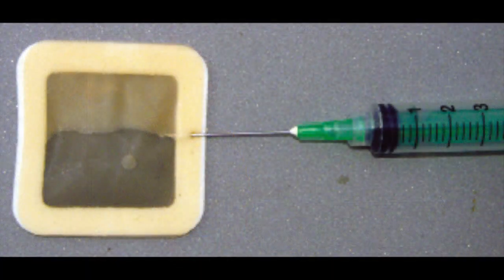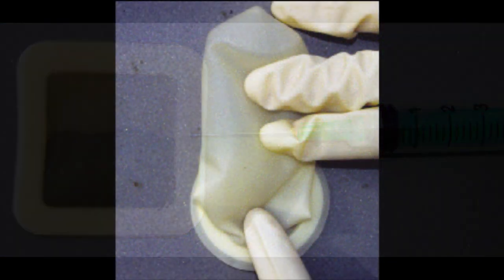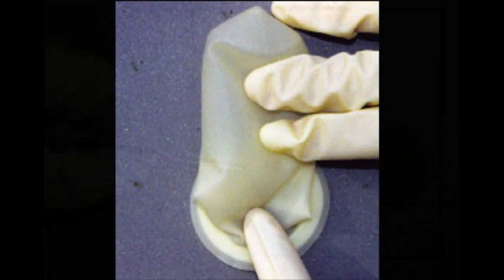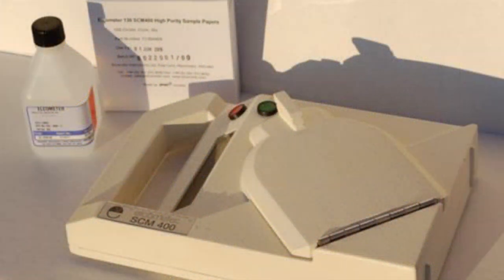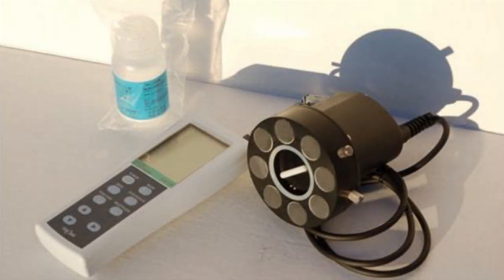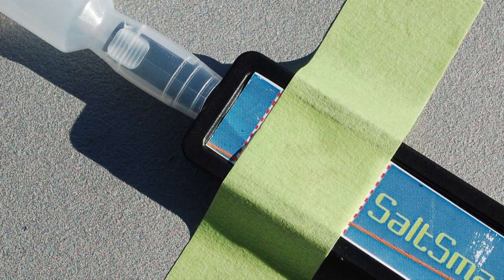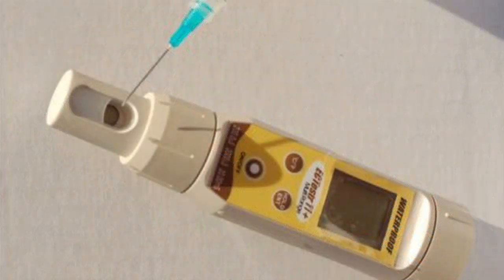SSPC Guide 15 also describes several methods of retrieval and analysis of soluble salts that can be performed in the field. These include the patch cell retrieval method, sleeve retrieval, swabbing, filter paper extraction, soluble salt meters, continuous flow extraction strips, and conductivity measurement devices.